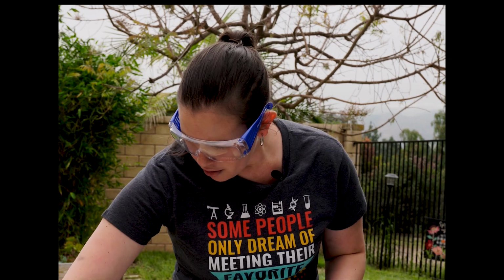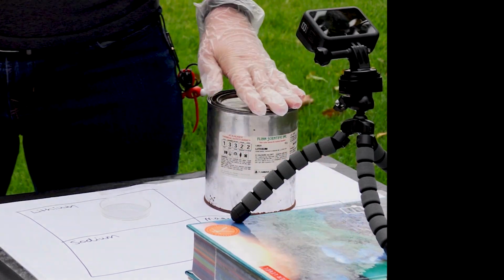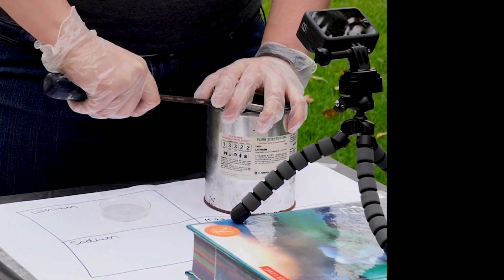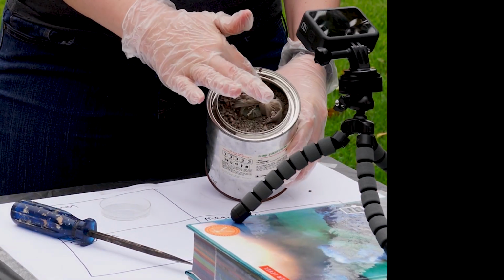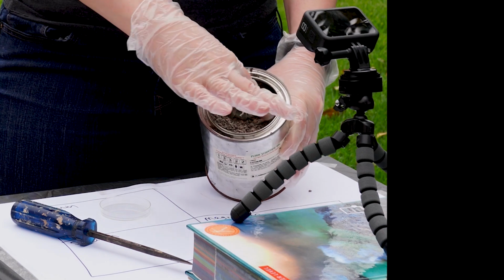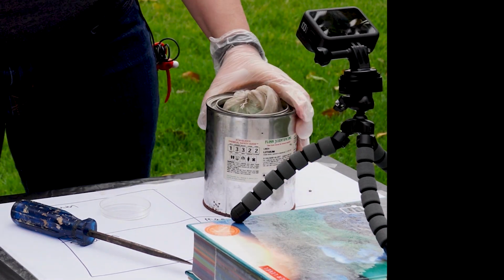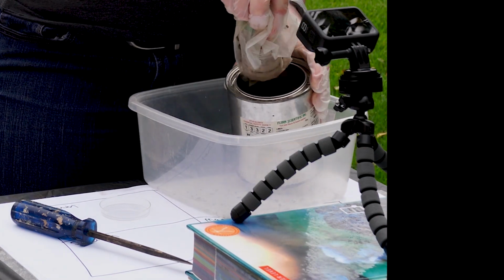So let's get started. First, I'm going to look at the lithium. Notice that lithium is stored almost in a paint can, a big metal can. So I'm going to need a screwdriver to actually even pry open the lid to get to where the bottle of chemical is stored. That bottle is stored in a separate baggie. Oh, lots of rocks going everywhere. With lots of stones and rocks around it.